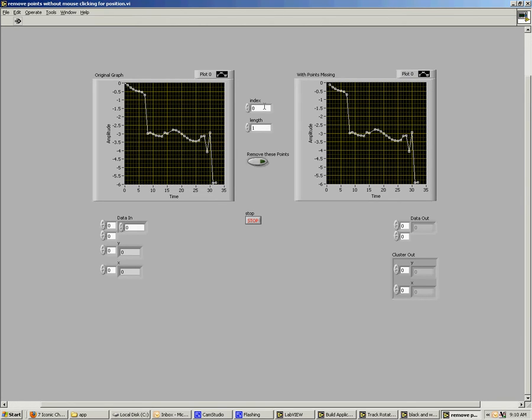Now this sub VI actually allows you to eliminate certain points from the data you got. The index refers to the points you want to remove, and the length is how many points in a row you want to remove. So if you watch this data, as I increase to 1, 2, 3, 4, you see the points actually are removed from there. So let's remove this section down here. Now there's the first one, and I'm going to increase the length. There we go. Now when I'm happy with it, I can click this button, remove these points, and this updates.